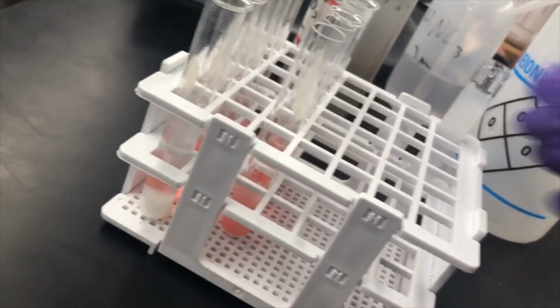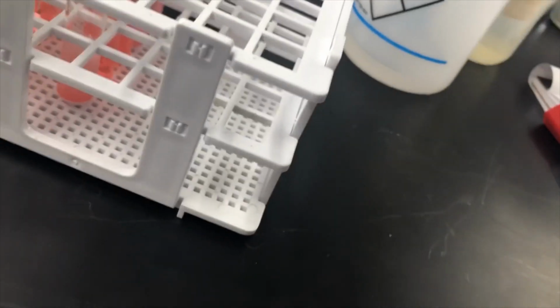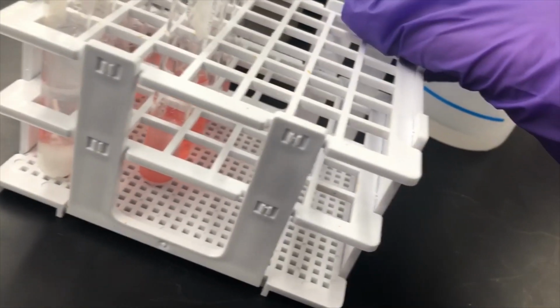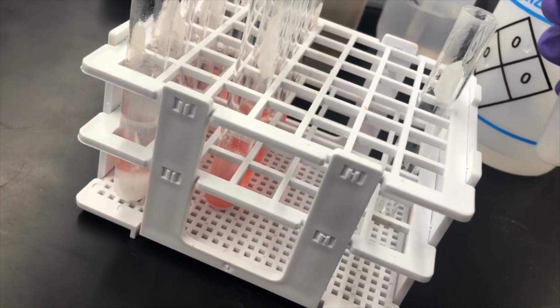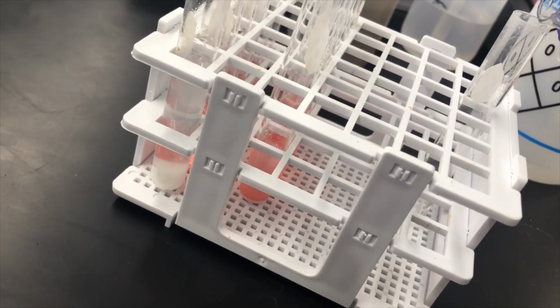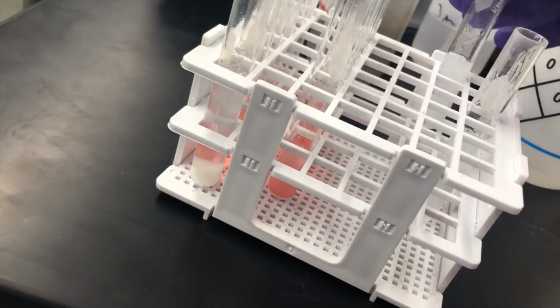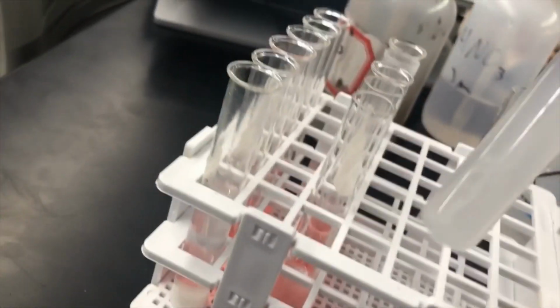That makes it a little bit difficult, but they are definitely both dissolving at least partially. So since I had to add a bunch of water, I'm going to transfer some to another test tube to make the test easier for the rest of this part. And now it's definitely easier to see that the solution's pretty clear.